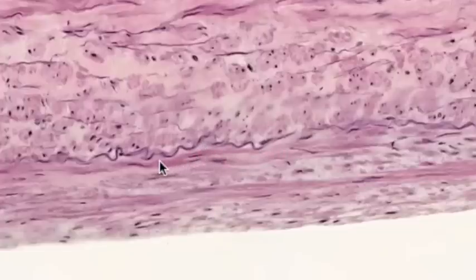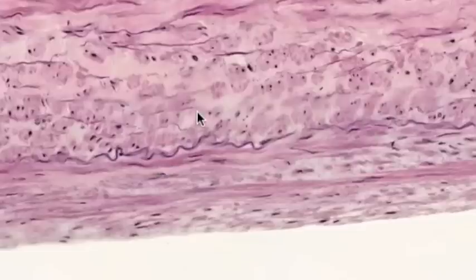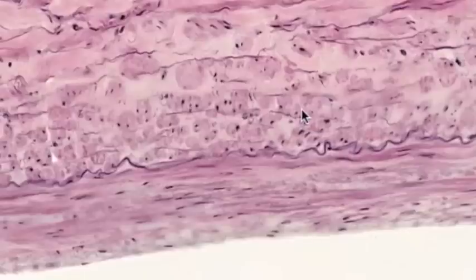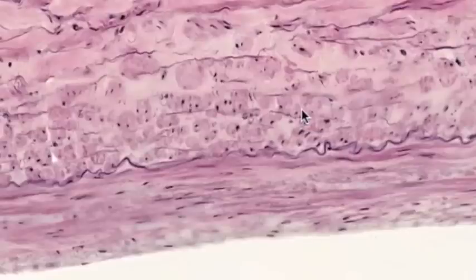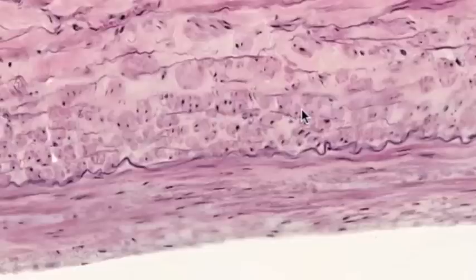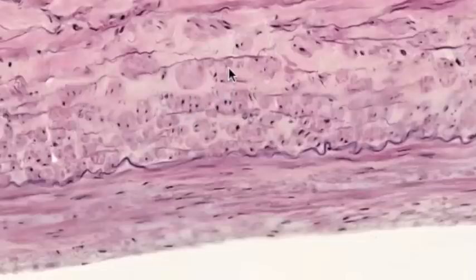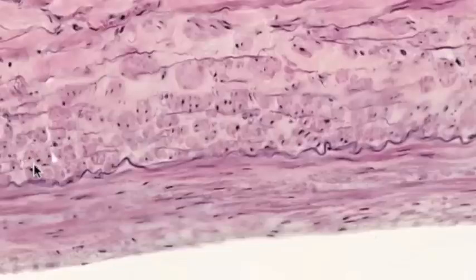You don't really see an internal elastic lamina in most veins, but you do in the very large ones. Inside that, we see the tunica media. The first part of the tunica media in the inferior vena cava consists of bundles of smooth muscle cells oriented longitudinally — with their long axis parallel to the long axis of the vessel. In a cross-section like this, the smooth muscle cells are cut in cross-section, and we see their nuclei here in distinct bundles. This longitudinally oriented smooth muscle region extends from here to the internal elastic lamina.